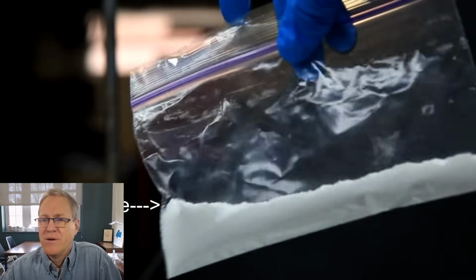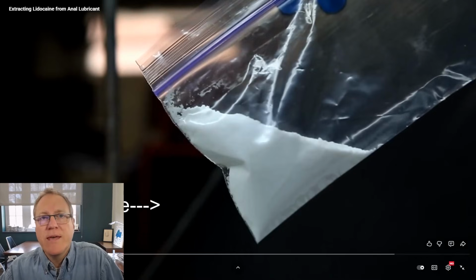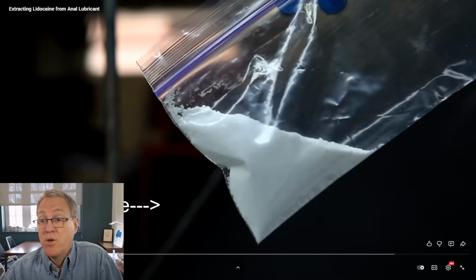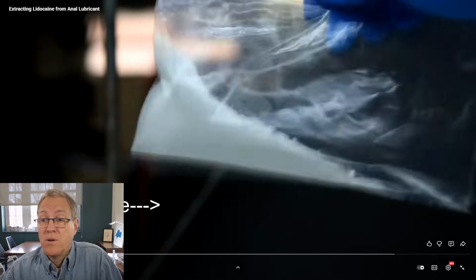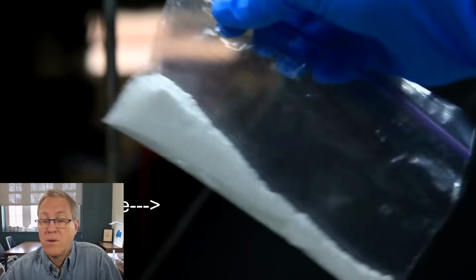In general, and just a little bit on how they work, you should check out my video on the synthesis of benzocaine. I'll try to put a link to that in the video description if I can find that video. I was going to be lazy and copy paste my intro from the other video, but I decided it's better if I just link back to it. Anyway, without further stalling, we can get on with the extraction.